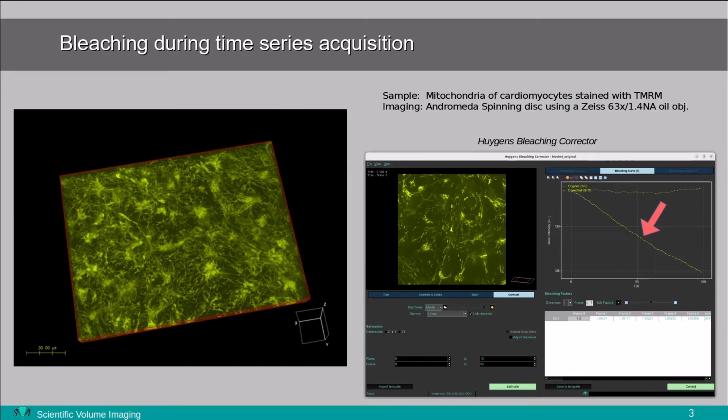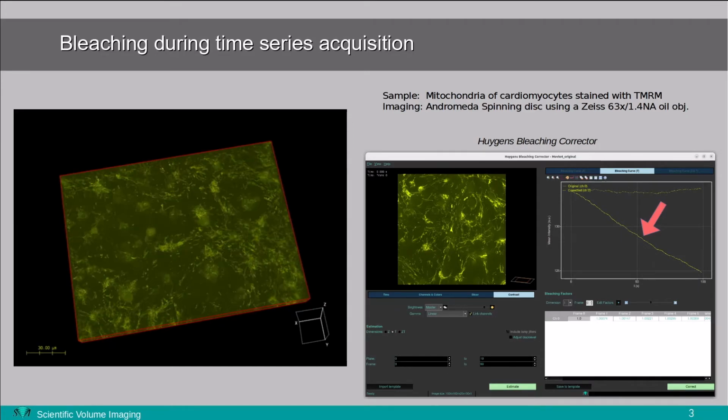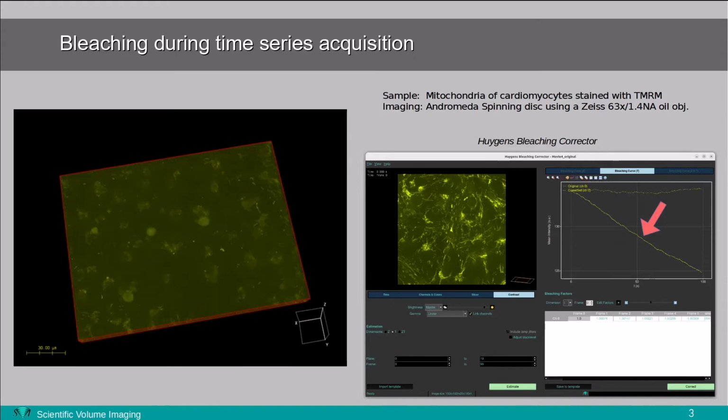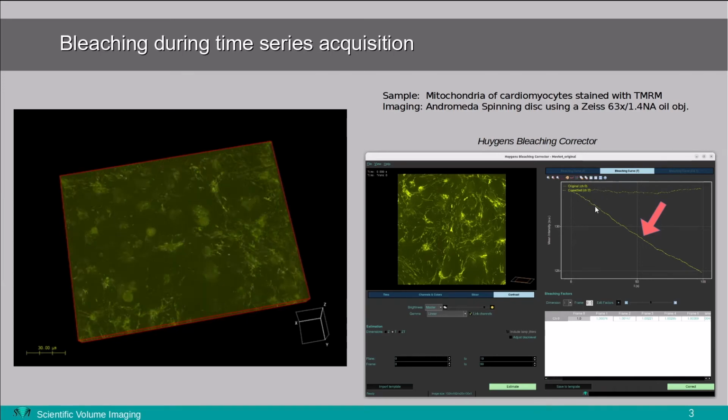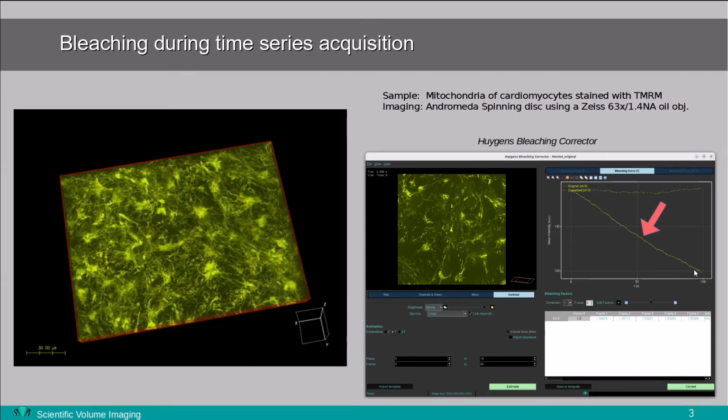Likewise, images that suffer from light decay in time are difficult to image. You see that here in this mitochondrial movie, and on the right side you see our bleaching corrector, and you see the decline in signal over time.